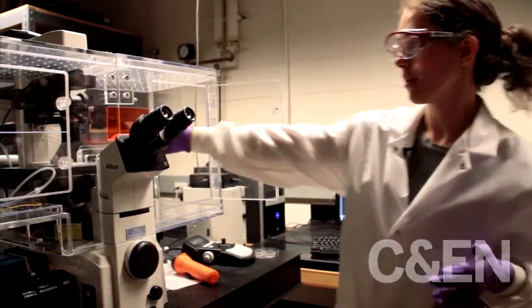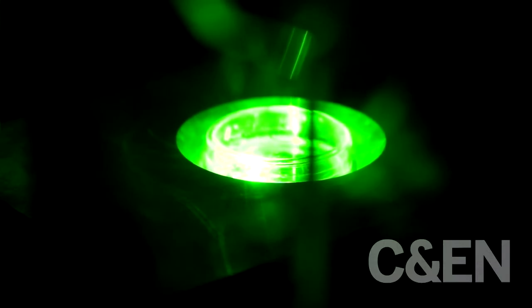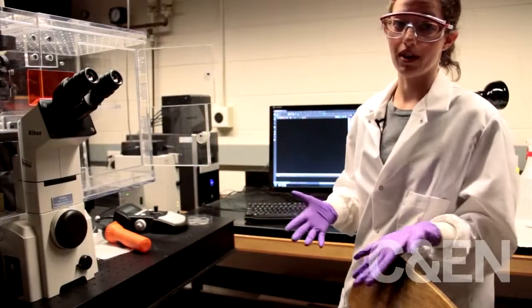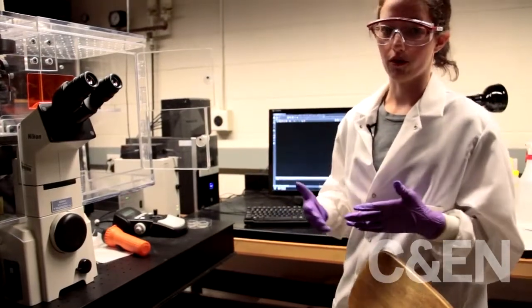And we just put it on the microscope. And then we are able to view the cells in a variety of different manners, both with the phase contrast, which is what you see normally with your eye, and also with different fluorescence.